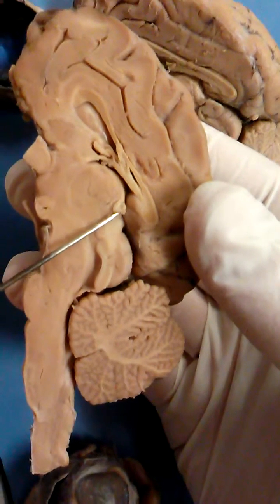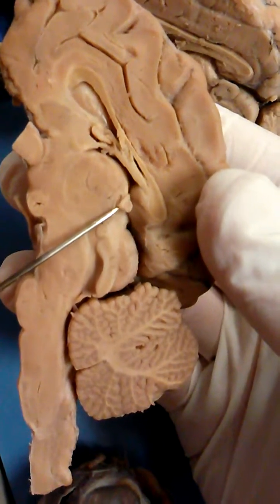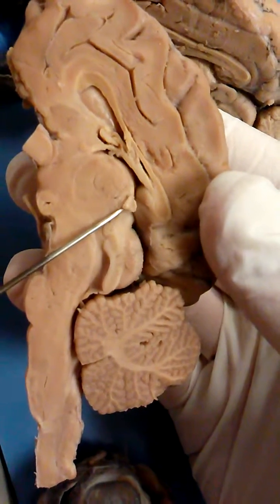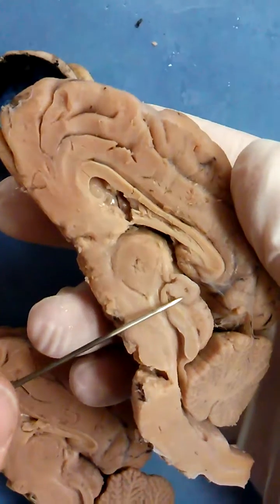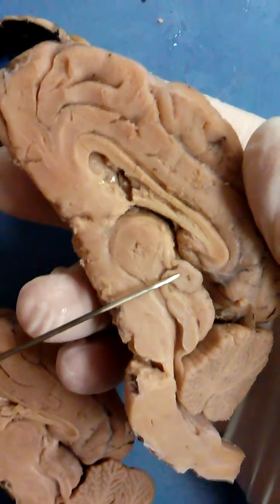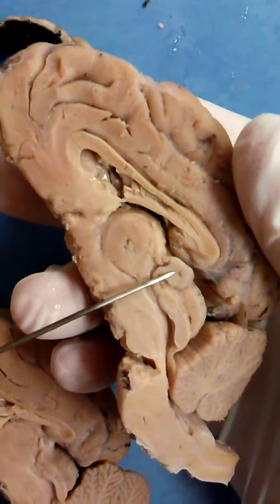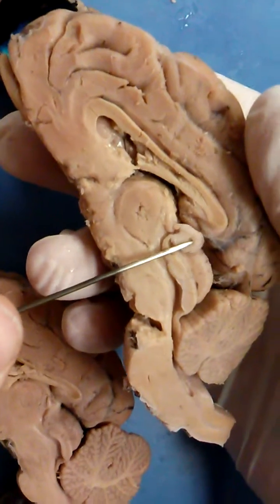Right here we have the pineal gland — the little bulby spot. That pineal gland is better; it's bigger, it's enlarged. You can say pineal gland or pineal gland — potato, potato.